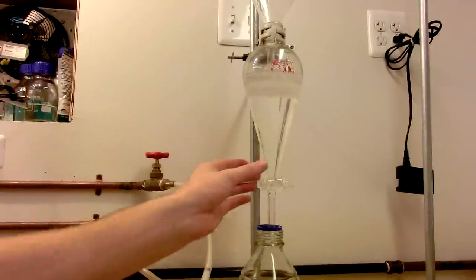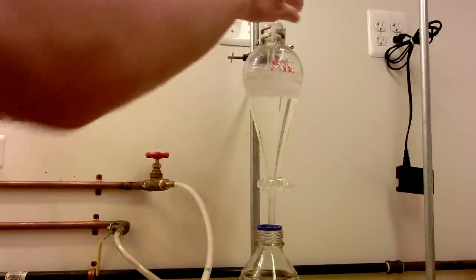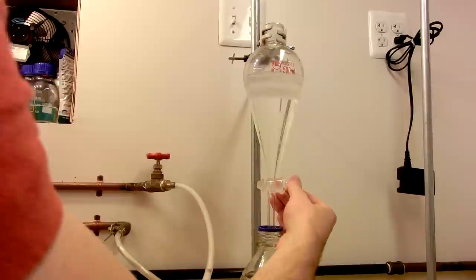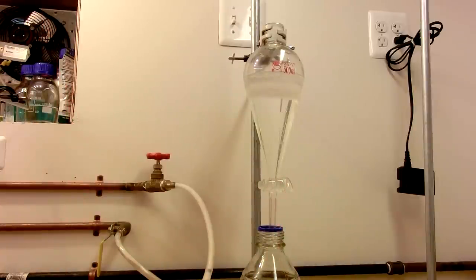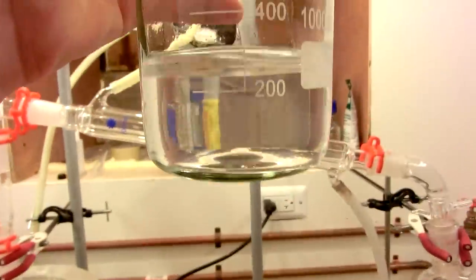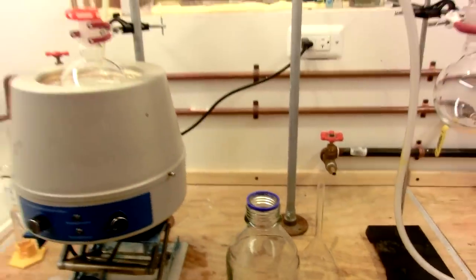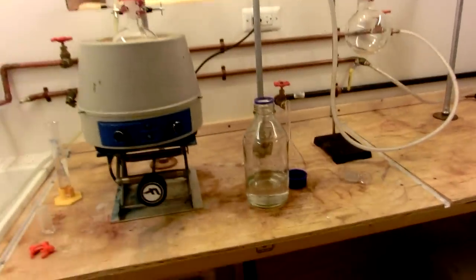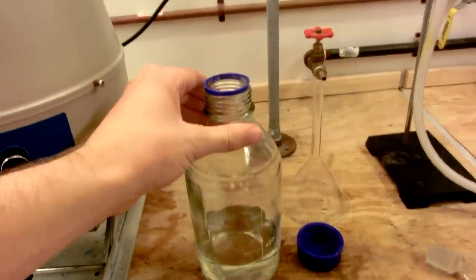You can see that the chloroform has collected in the bottom and in the top we have mostly water. With the removal of the funnel, we'll now begin to drain the chloroform off into the bottom container. Here is the raw chloroform — about 300 milliliters. It is wet and has some contaminants, so I've set up here for simple distillation. We'll run this chloroform through to recover some high purity, though still slightly wet, chloroform.